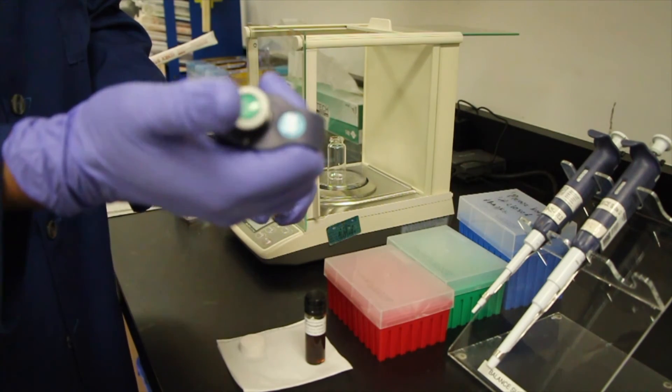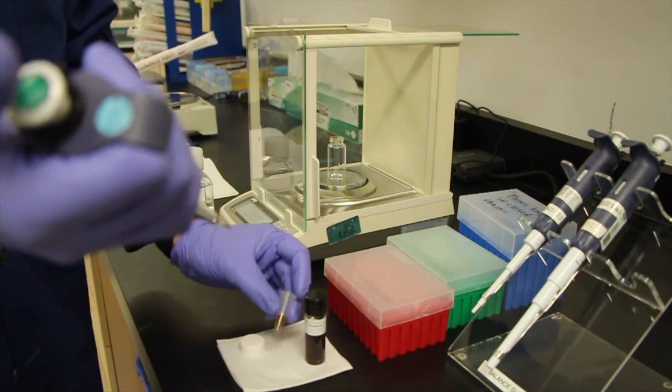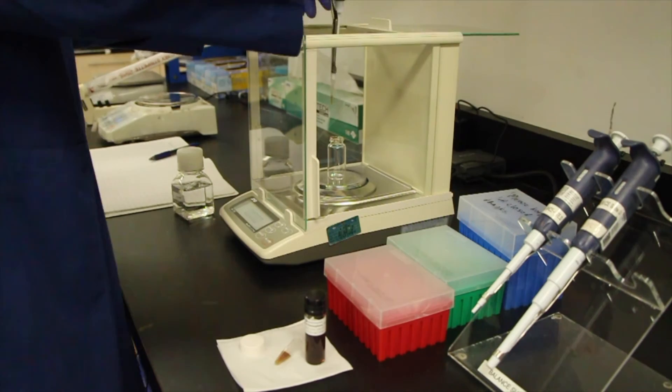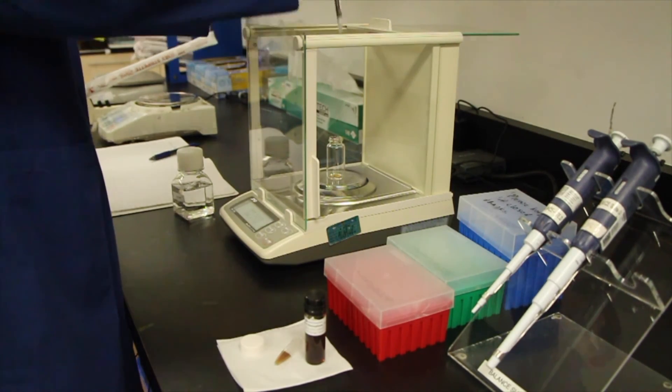For this I'm going to need about 50 microliters of this BioPure solution and I'm going to dilute it up to about nine and a half mils with water.